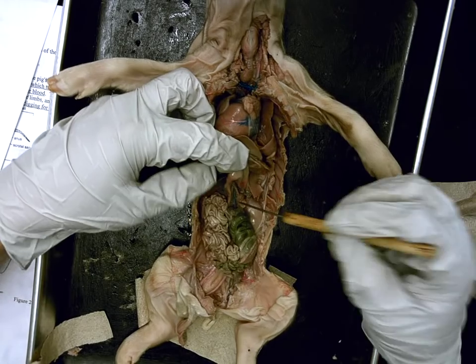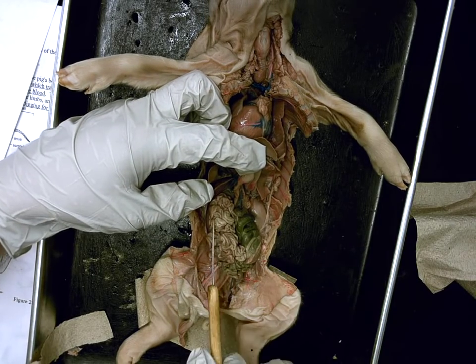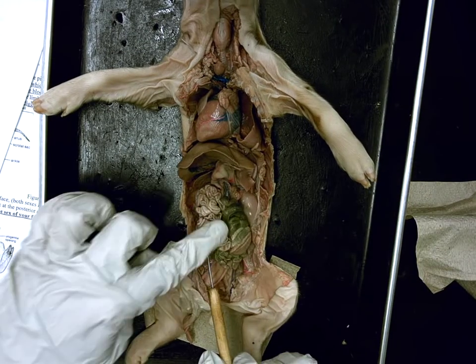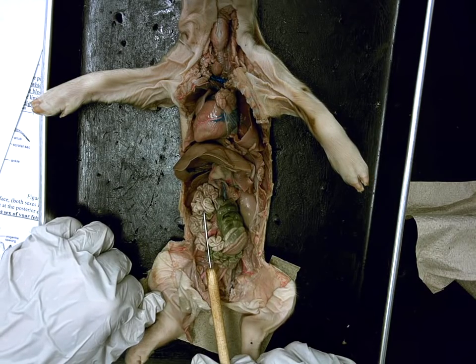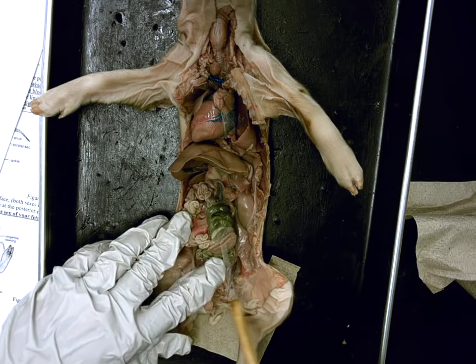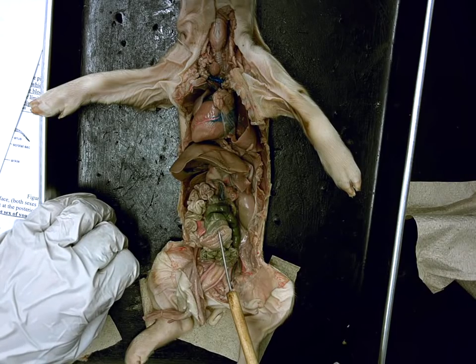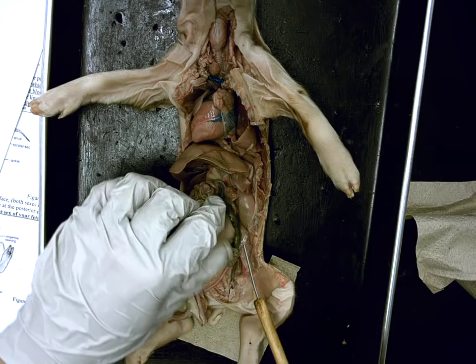If we go from the pancreas, Phoebe, we have all these tiny little skinny, scrawny tubes — these would all be the small intestine. Excellent. Small intestine has two functions: further digestion and nutrient absorption. Excellent. Gabby, then we have this big wound-up tube — that's the large intestine. Two functions: reabsorption of water, and packing feces. Excellent. Mostly reabsorption of water in the large intestine.